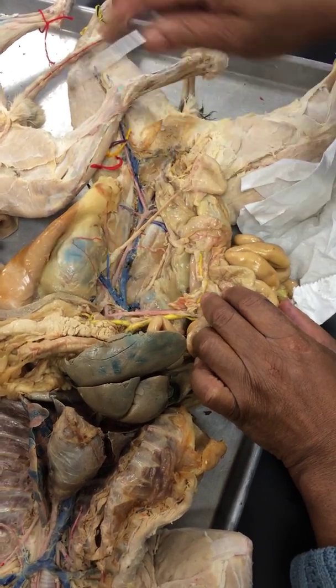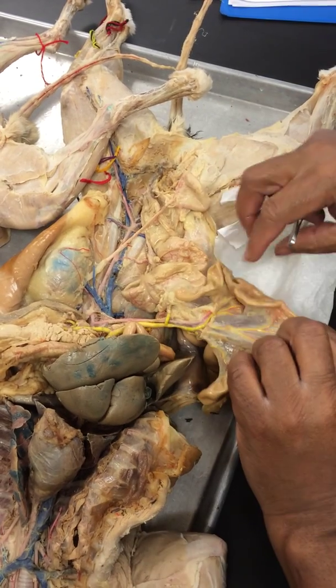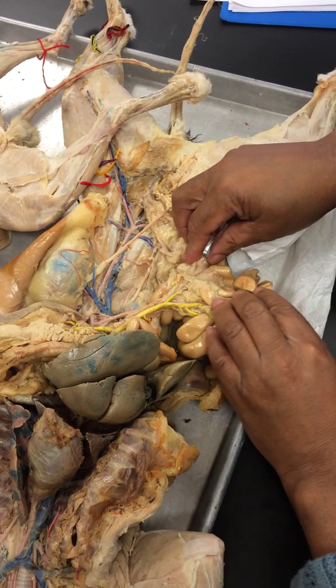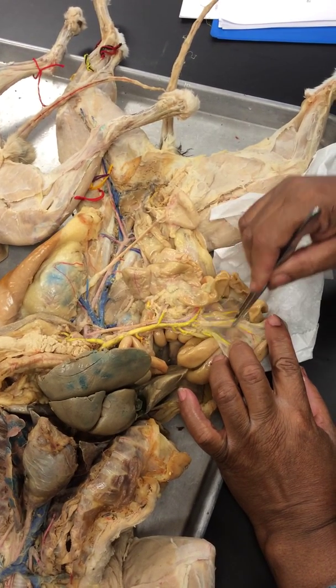So if you look at the little diagram there, if you open up your small intestine, you'll see these yellow thingy in the mesentery. Those are all veins, by the way. I noticed some people today didn't put veins on it because I think they don't know if it's veins or arteries. These are all veins.